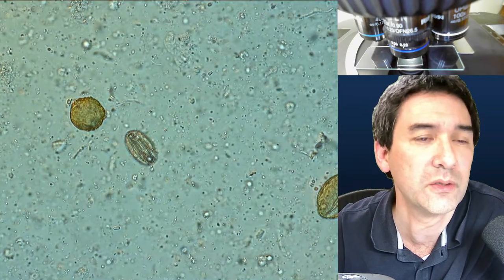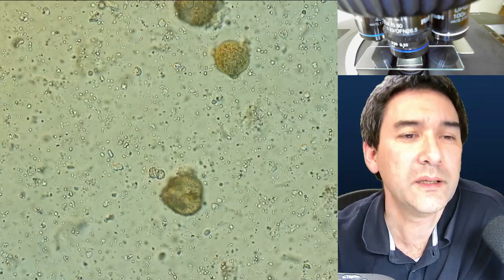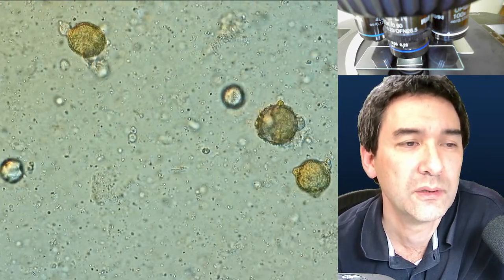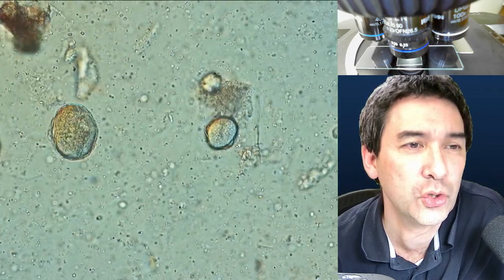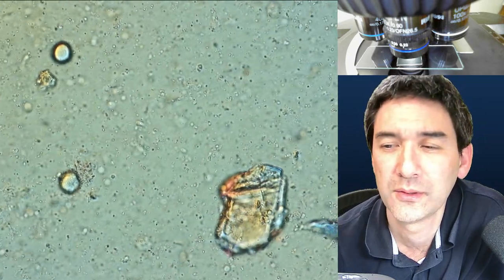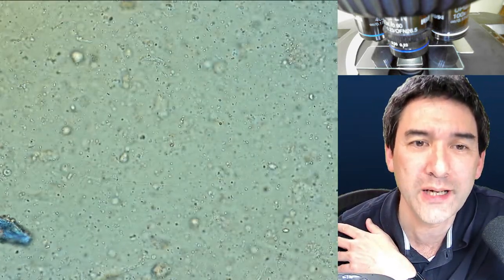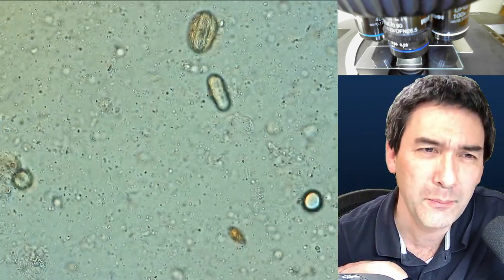If you want to see some color, we can do that. Just by looking at the pollen we can see there are many different types, different shapes, and so on. I wonder if by changing the sugar concentration some of them would actually start to form pollen tubes. I'm now using a 60x objective. I do have a 100x oil immersion objective as well, but I rarely use it.